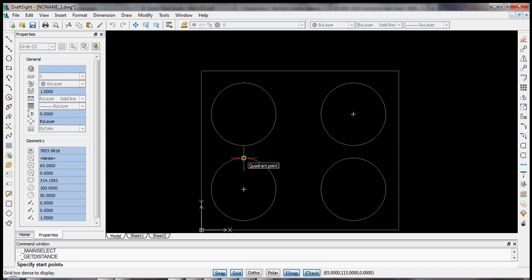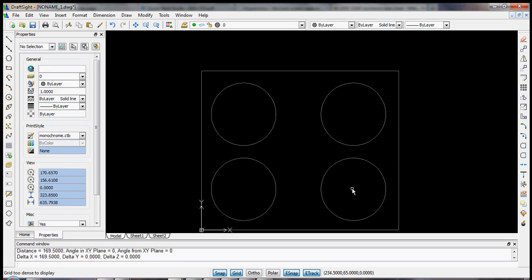And we may have to move the cursor to some part on the edge of the circle that will make the center point pop up. And we can click that point. We'll do the same over here. Now we see that our center points are exactly 169.5 millimeters apart.